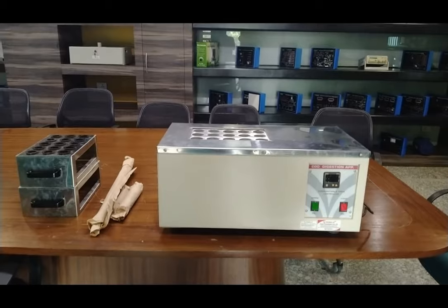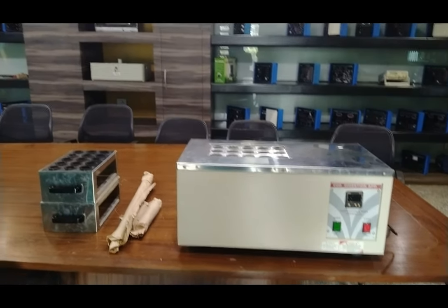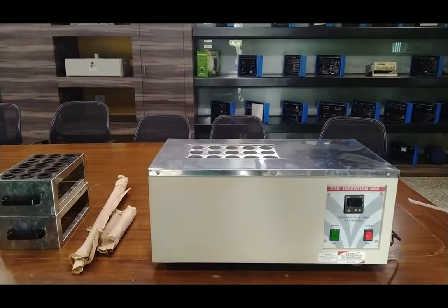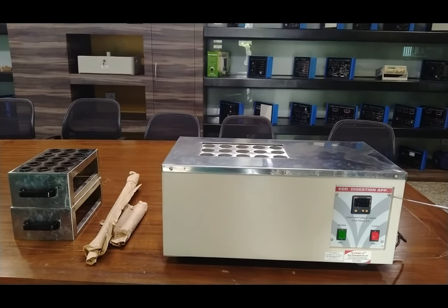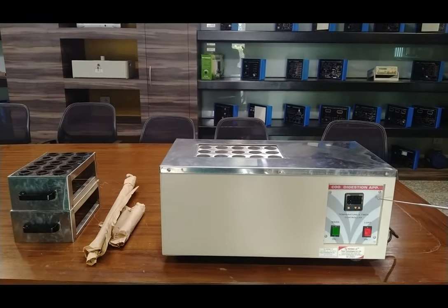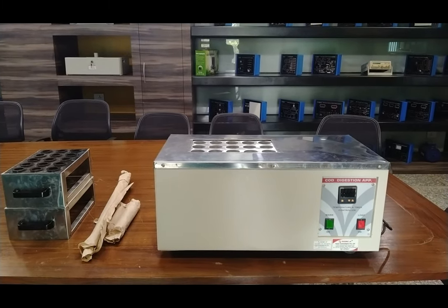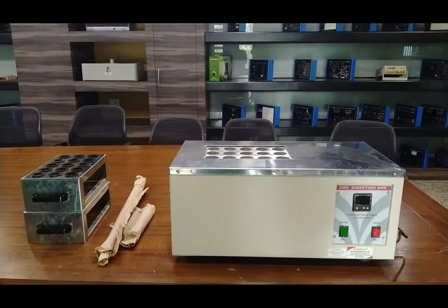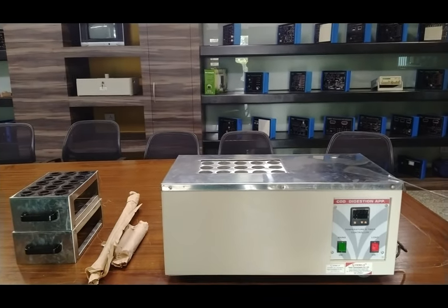Hello guys, welcome to Tesca Technologies Private Limited. This is a COD digestion apparatus. These COD apparatus are used in various laboratories and pharmaceutical industries for wastewater and industrial process water monitoring and checking.